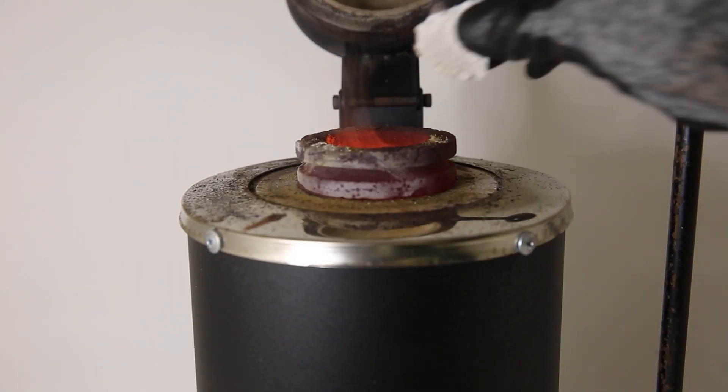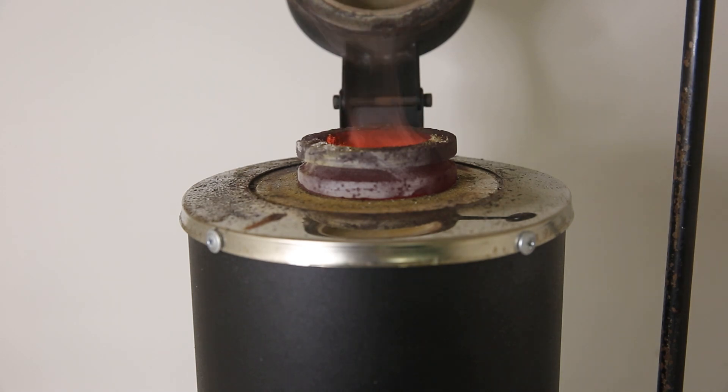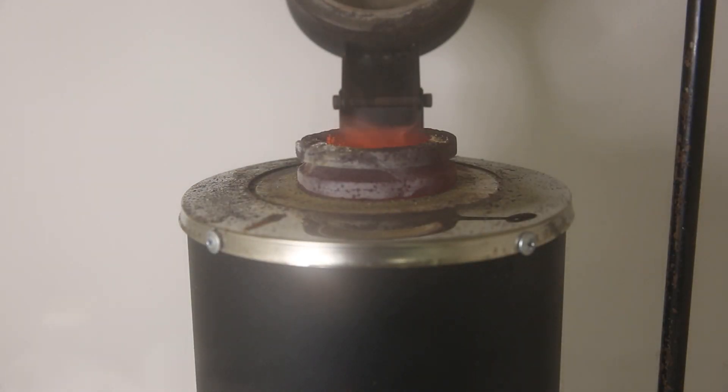While the first bit has molten, I add the remaining silver chloride slowly, mixed with the flux. I leave the furnace running for a while to allow the silver to form. It actually takes quite a while and a lot of the silver chloride will remain if it is taken out too early.